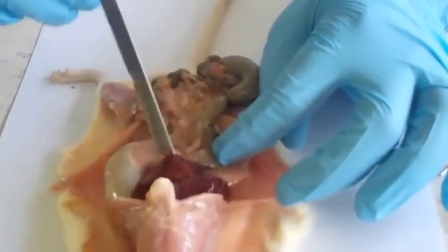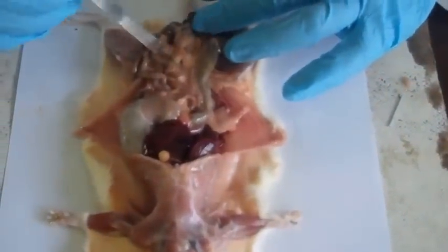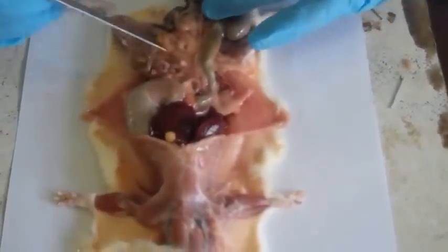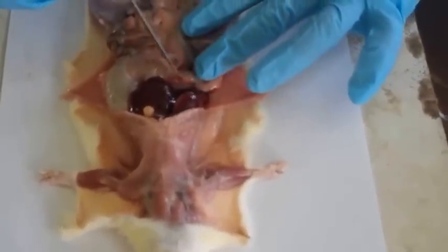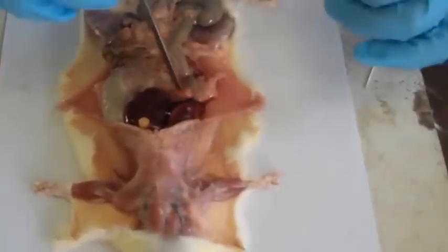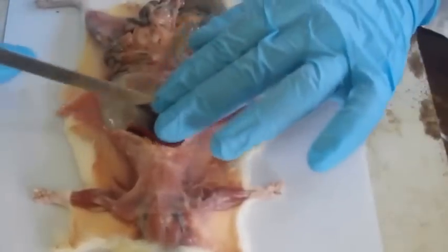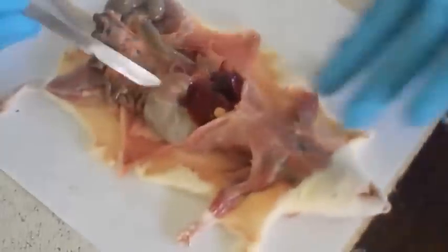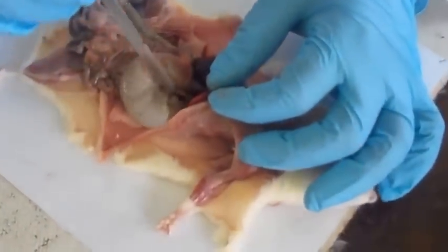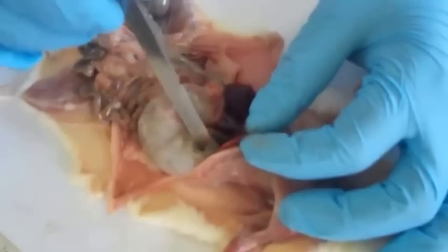Sorry. We have displaced our ileum to the left of the animal. Then we'll displace the duodenum to my left. And then we are going to displace the liver lobes anteriorly so we can be able to see the esophagus inside. So as you can see, the esophagus is this tube that is connecting to the stomach.